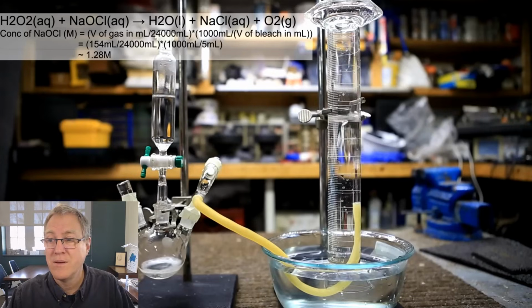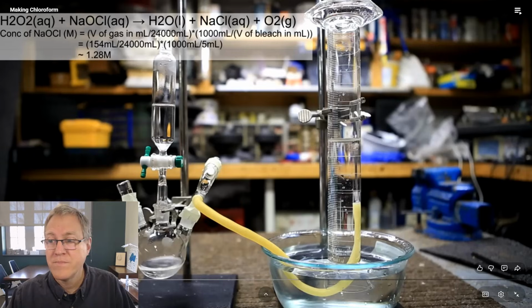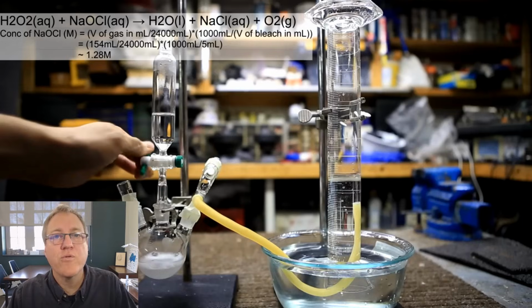Hydrogen peroxide is added until no more bubbling occurs and the reaction is complete. The level of the water in the graduated cylinder is measured before and after the addition of the gas. By calculating the amount of gas that is evolved, and on the assumption that 1 mole of gas occupies a volume of 24 liters, we can calculate the concentration of the bleach. So there's a perfect gas law coming in, 24 liters per mole.